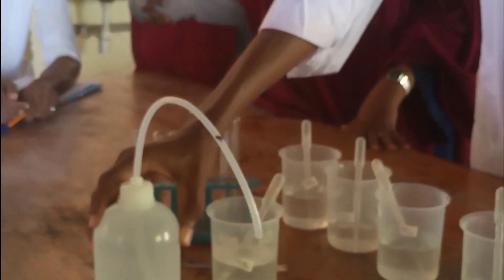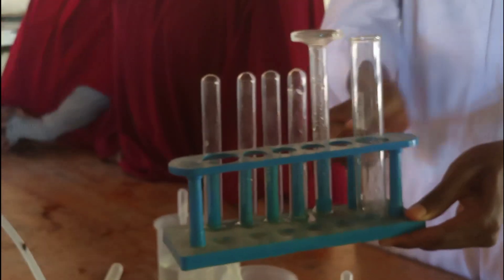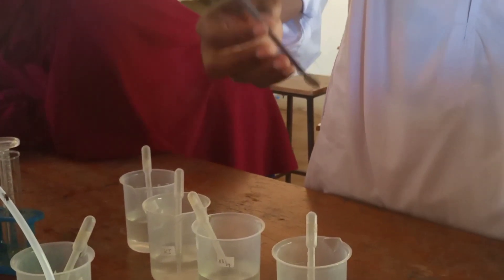Other than the reagents, we will be using distilled water as a preliminary test — that is a wash bottle containing distilled water. We have a rack containing at least four test tubes, one boiling tube, and one measuring cylinder. We will also be using a spatula to scoop solid N.